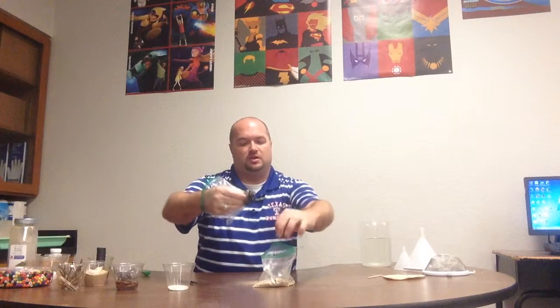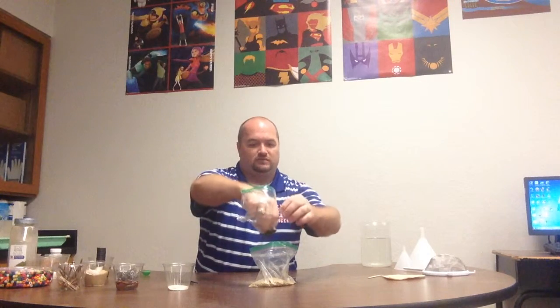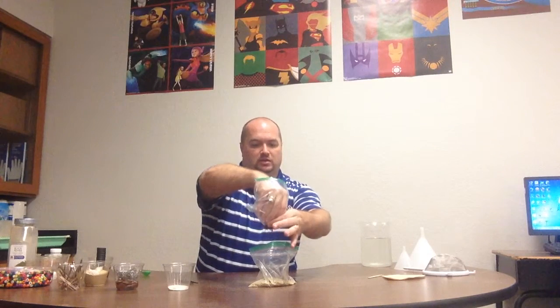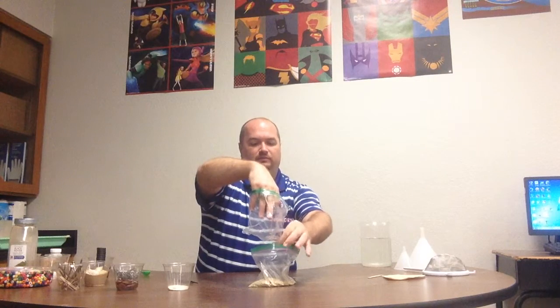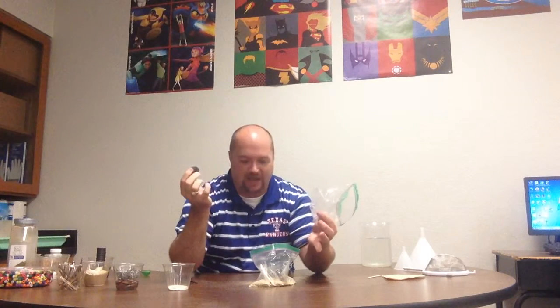Now if I want to take them off, it's just a matter of holding the baggie and pulling your magnets away. And now your magnets are completely clean, all your iron filings back in the bag, not scattered all over your table, which is very nice because the iron filings are tiny and very challenging to pick up. So, whenever you're using iron filings, magnets inside a baggie, always a good decision.